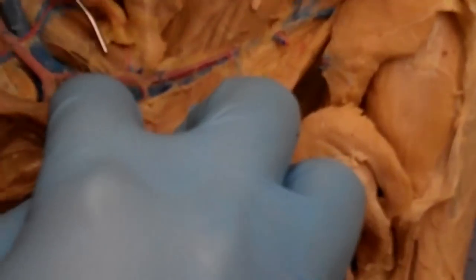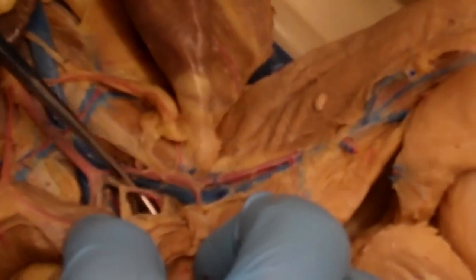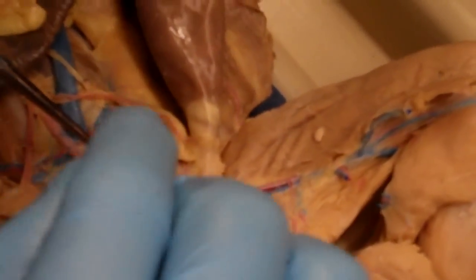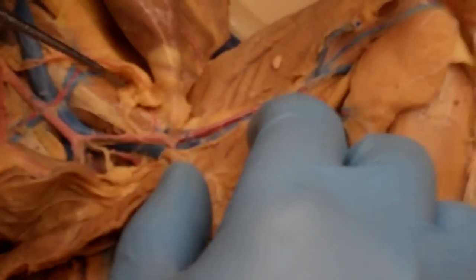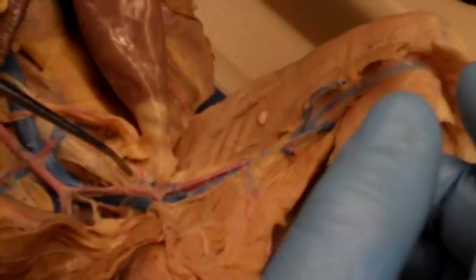but we can see the first couple branches. So the book mentions this middle hemorrhoidal artery. It's a branch off the internal iliac artery. Don't worry about it. You have to really dig to get it out. So you can cross out the middle hemorrhoidal artery on the bottom of page 33. It's one of the branches off the internal iliac, but you have to split the pelvis and really dissect. Yeah, just cross it out. It's not clinically that important.